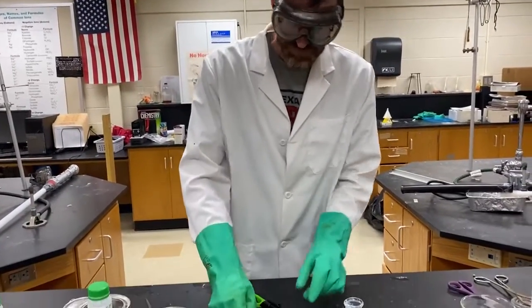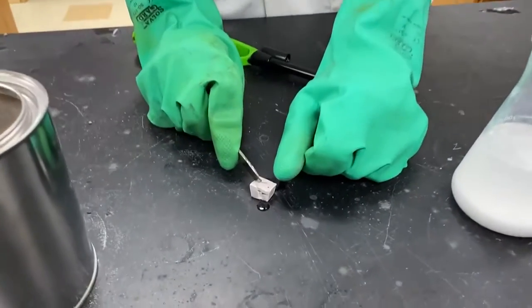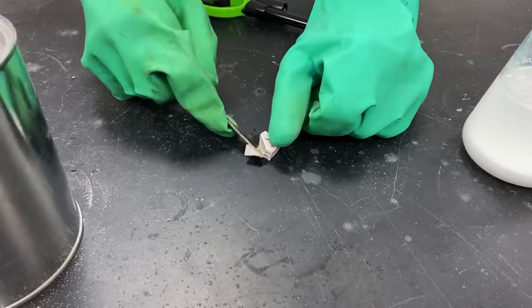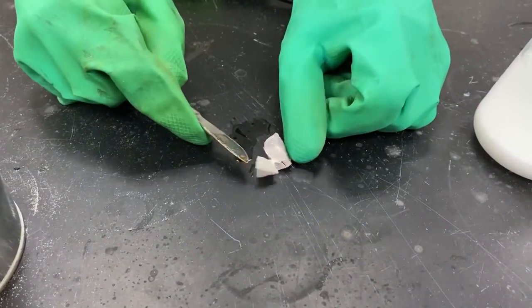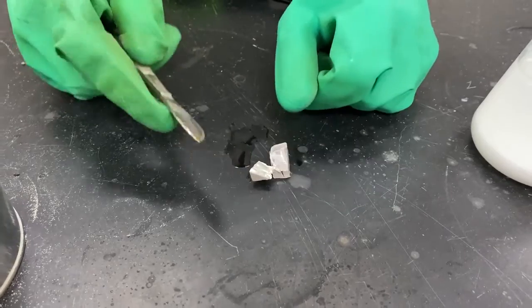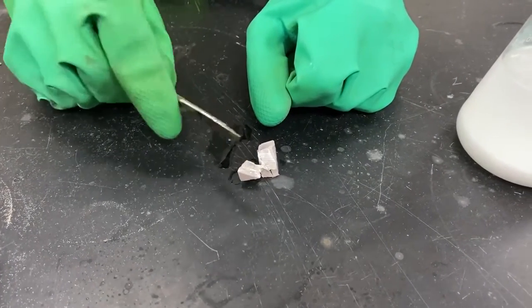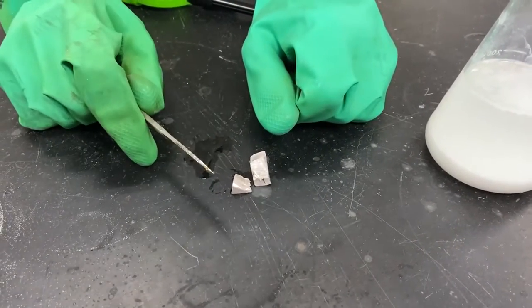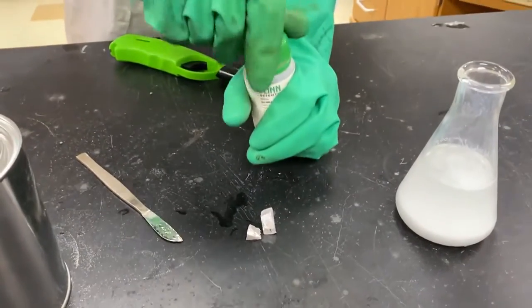As you watch, I will cut it. Now, as I cut it, there we go. Look, it's shiny because that inside part has not oxidized with the air yet. So that is what the metal looks like, shiny, and it is soft. Now, back to the question of what is in this. This is mineral oil.